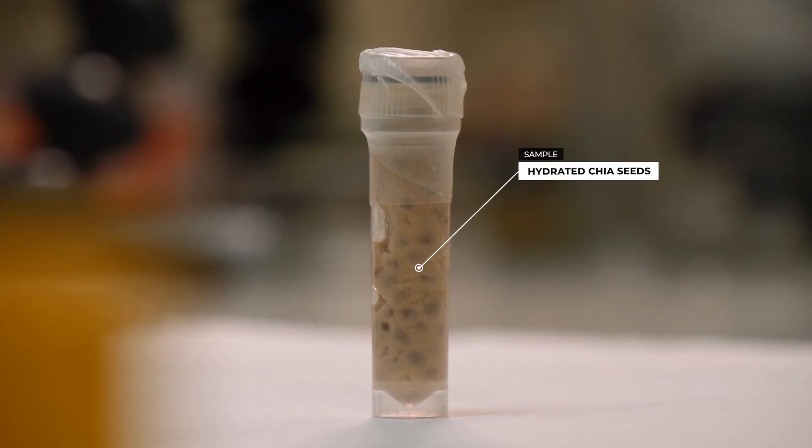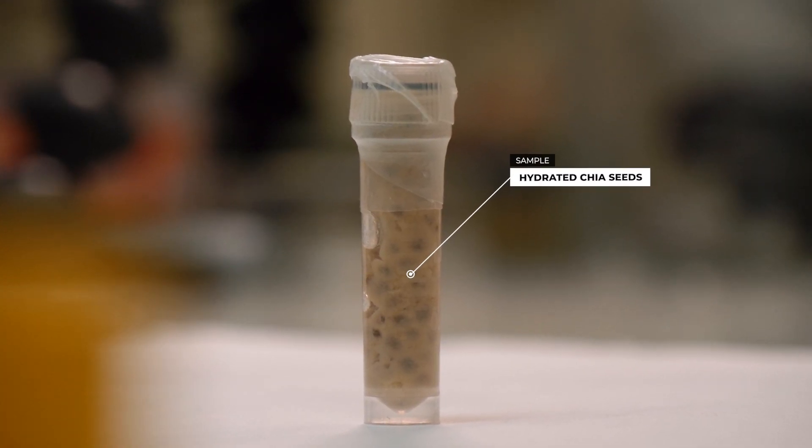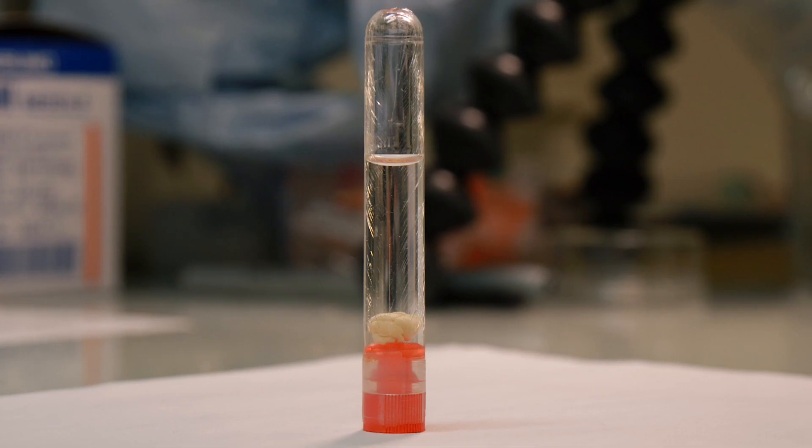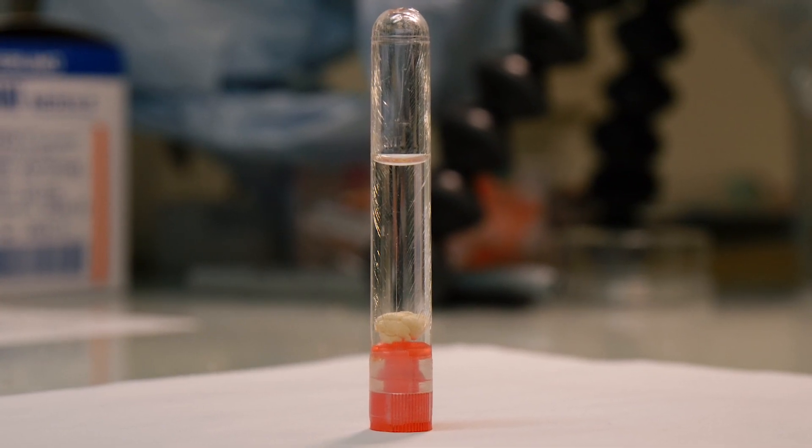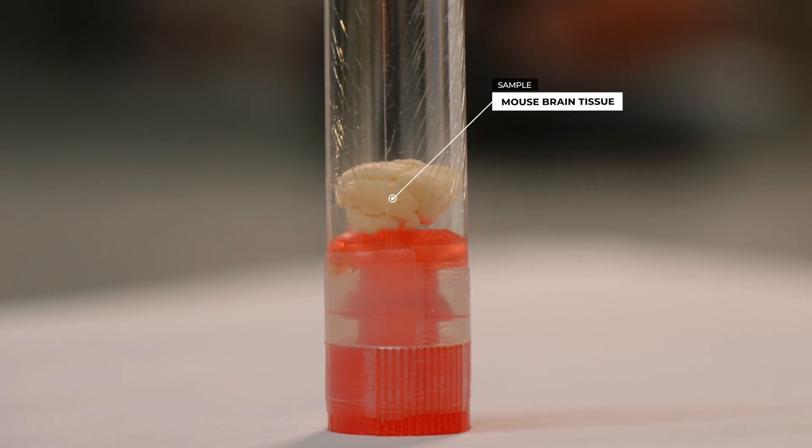Samples in liquid are held in plastic containers. We choose a suitable container and glue it onto a support disk.